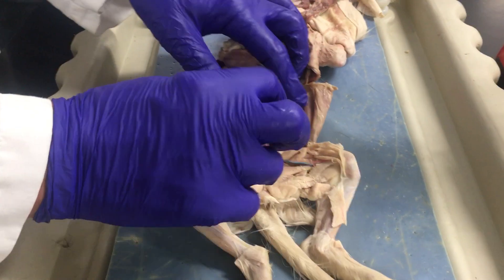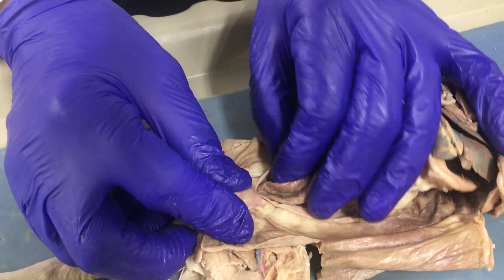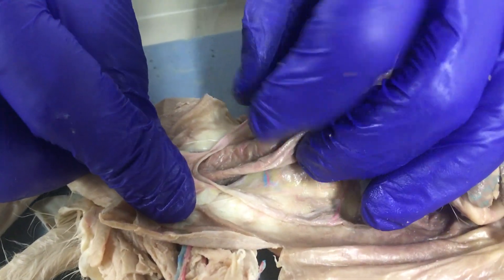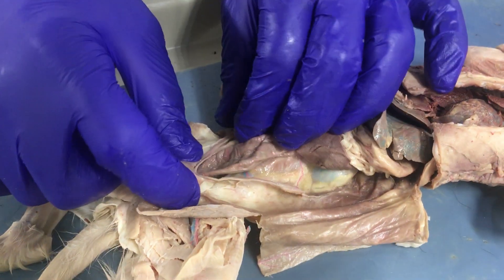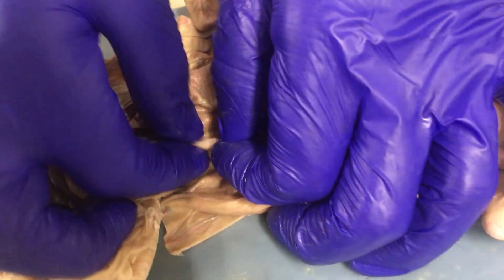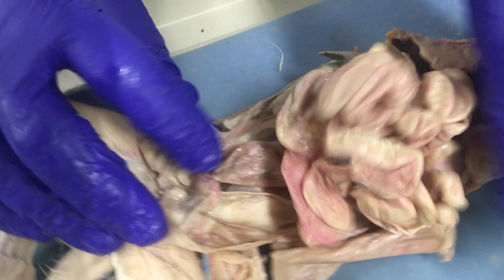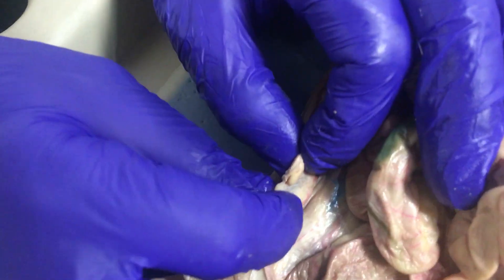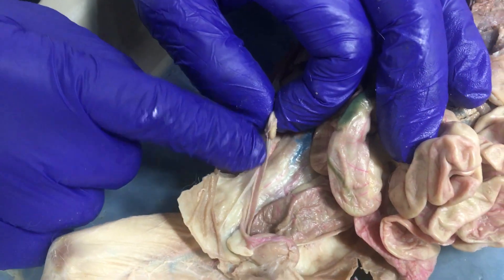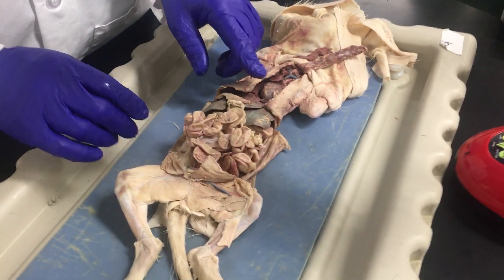We'd like to identify some reproductive structures. This is a female cat, and there is a uterus which consists of two long tubes — we call it a bifurcated uterus. This is the left horn and this is the right horn of the uterus. Following it out, it ends at the little bean-like structure which is the ovary. There's a left ovary and a right ovary, and the tissue cradling the ovary is the fallopian tube. That's the reproductive system of the cat.